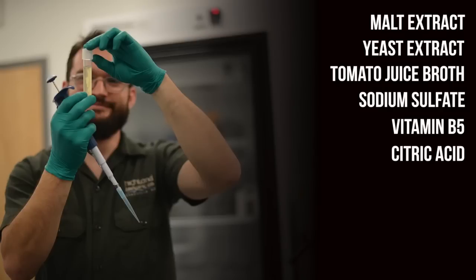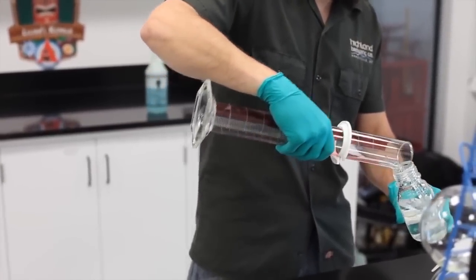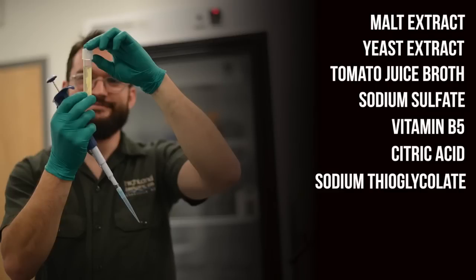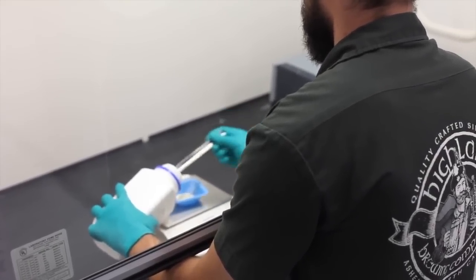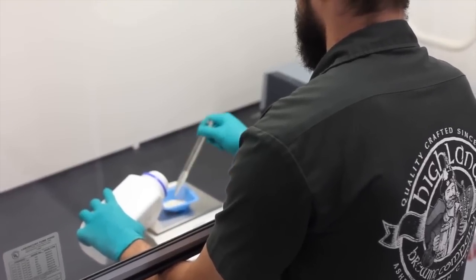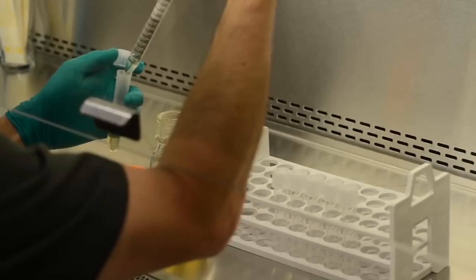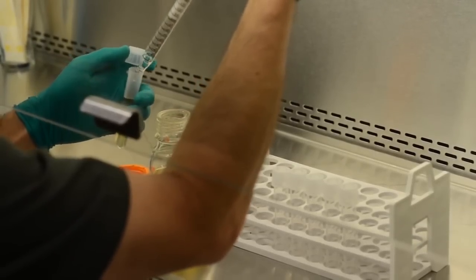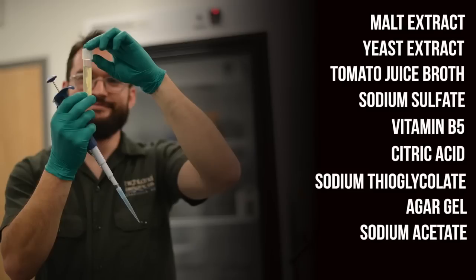Citric acid is added to adjust the pH down to optimal growth conditions for lactic acid bacteria. Mercaptoacetic acid, whose conjugate base is sodium thioglycolate in this media, is used to scavenge any dissolved oxygen and creates an anaerobic condition inside the HLP tube. This means that you don't need an anaerobic incubator, which is partly why this media is so popular with craft breweries. Agar gel is a thickening agent used to keep the sodium thioglycolate evenly distributed throughout the tube. Otherwise, you would have an oxygen gradient throughout the tube with aerobic conditions near the surface and anaerobic conditions near the bottom. Sodium acetate suppresses the growth of gram-negative bacteria.